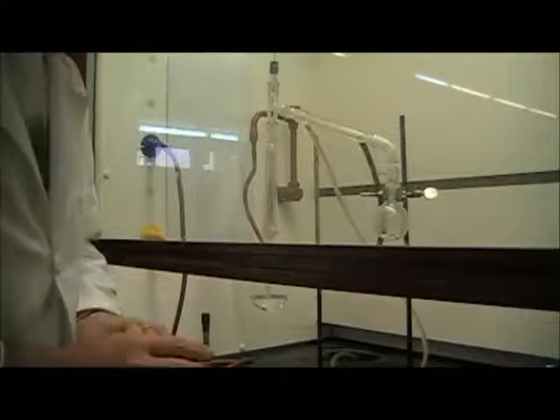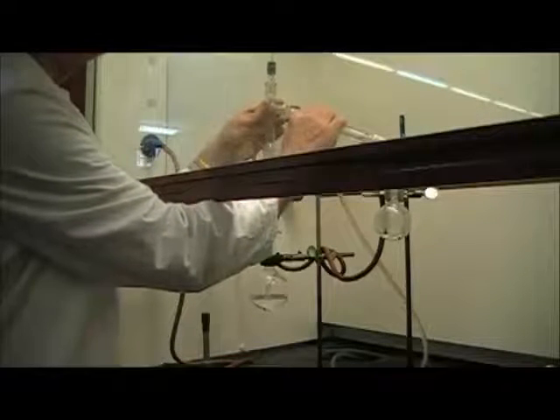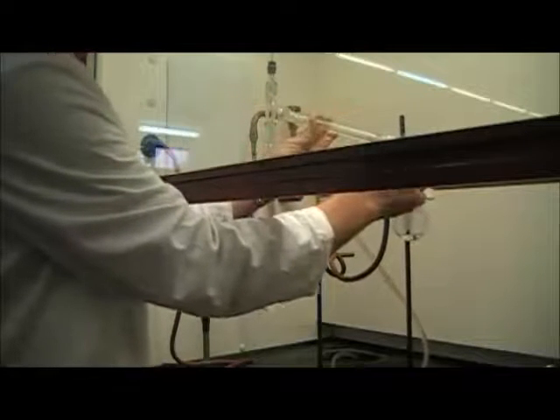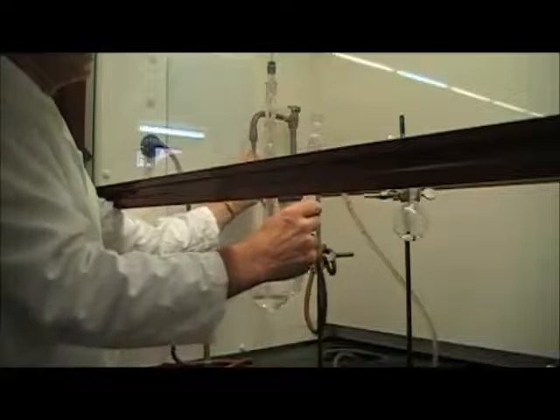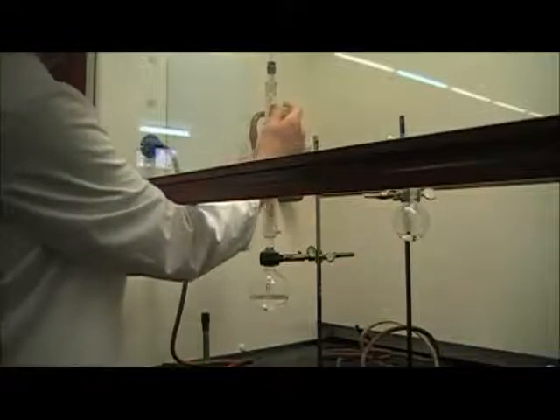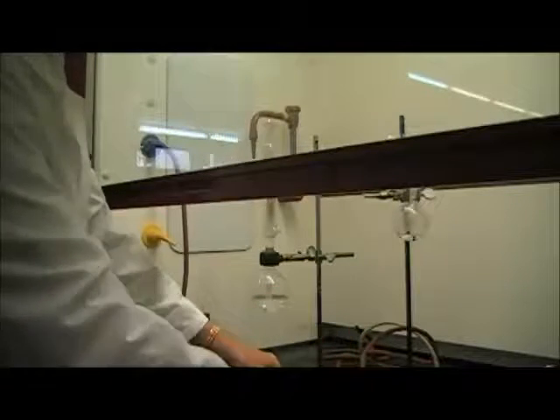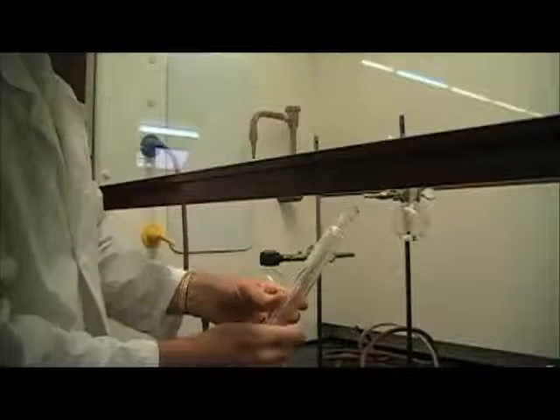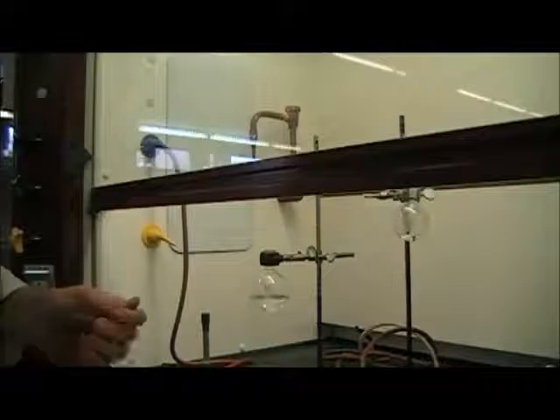I've now let the apparatus cool somewhat, and I'm going to show you how to take it apart. Just remember to take it apart from the top. So I'm first going to take the distillation head, separate it from the condenser. The water is still flowing through there, so I'm going to turn the water off. When I detach it from the water faucet, you can see that the water runs out of the jacket. Then I'm going to take the still head off, take the thermometer out. I can set those pieces aside, take the thermometer out of the thermometer adapter, clean those pieces up, put them back in the kit, take out the distillation column, and I can take out the copper and either recycle it or throw it away. Finally take out the collecting adapter and clean it up and put it away. And then my two round-bottom flasks I will empty into whatever container they need to be emptied into.